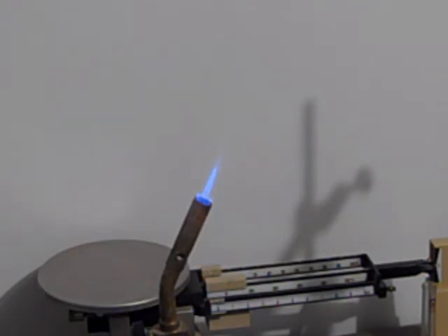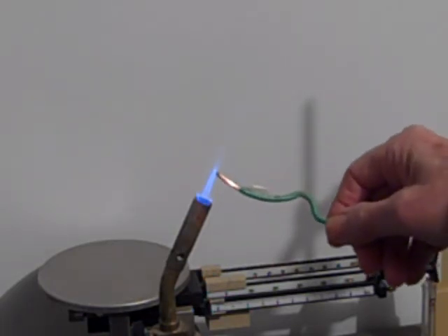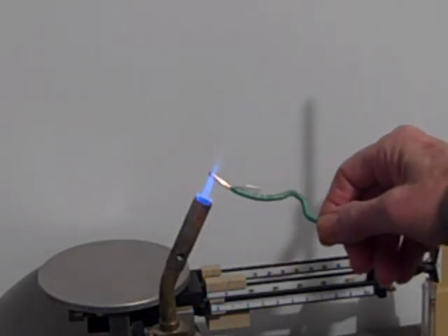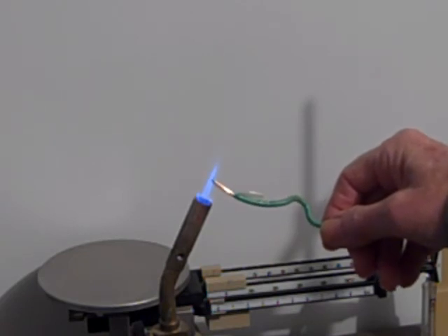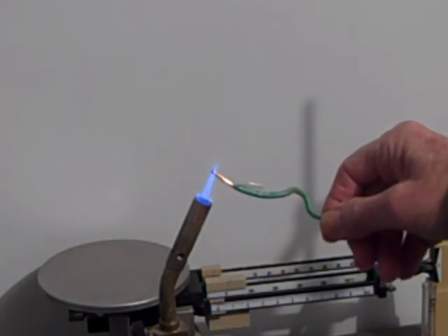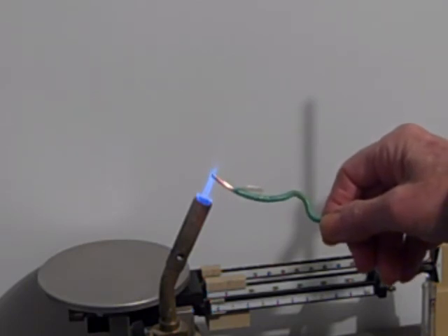Alright, we also have some copper wire. I couldn't get any copper salt. Let's see if we can get copper green from the copper wire. It usually gives you a green copper. I'm going to have to heat it up very hot to get it to vaporize a tiny degree.